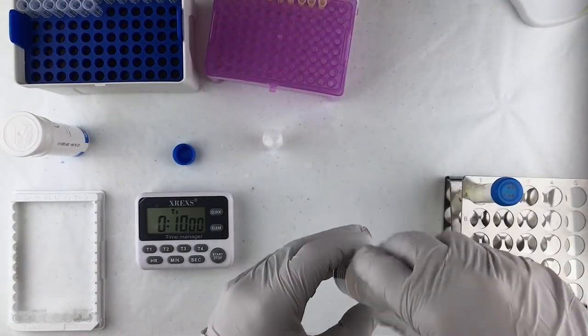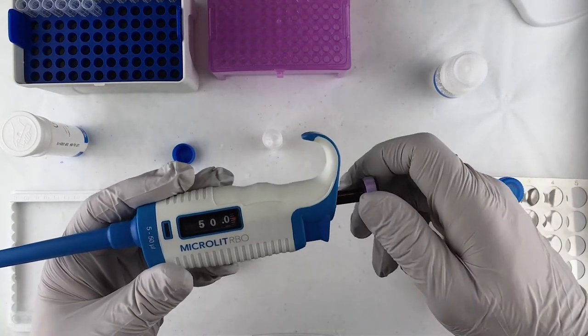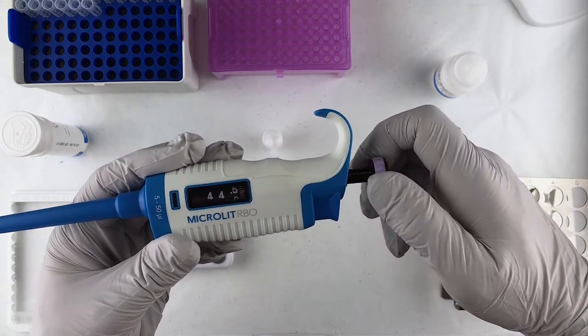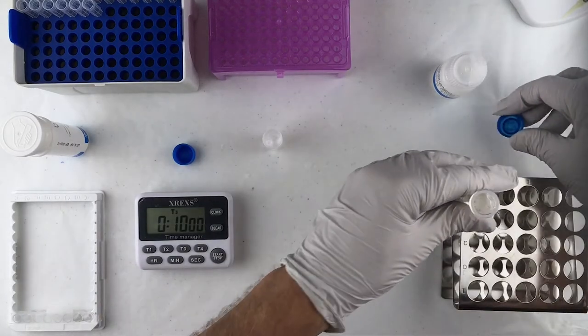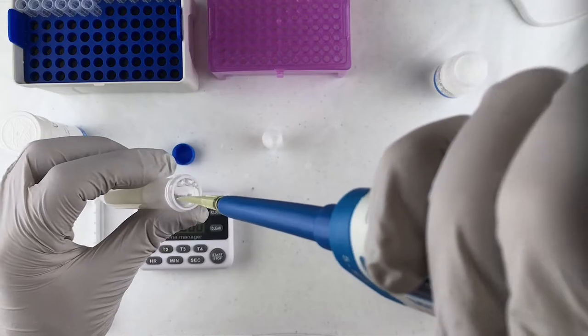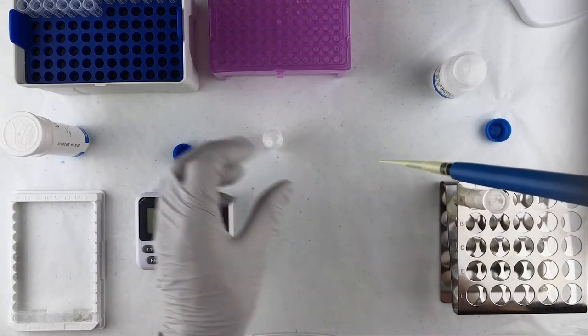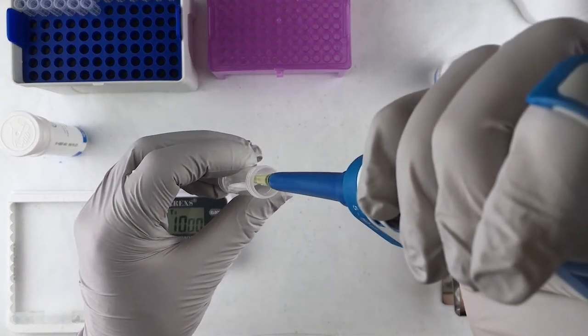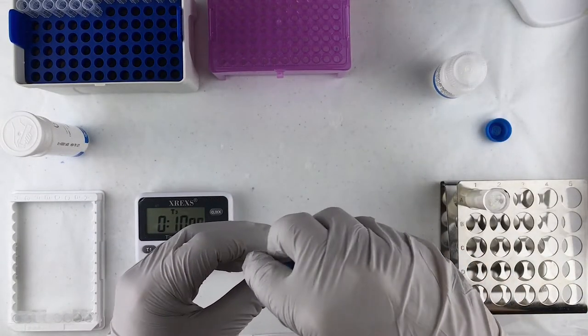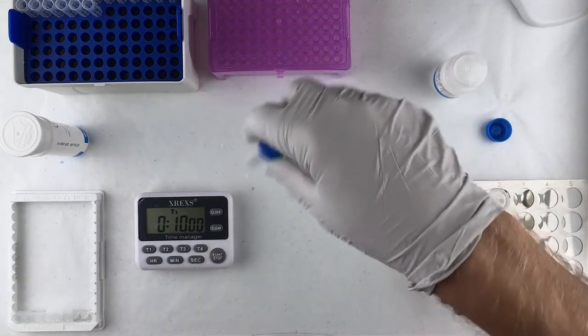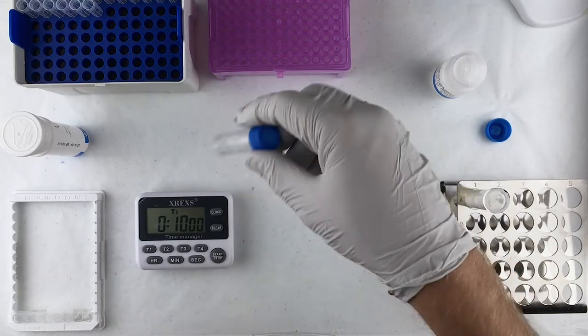Okay, so there's our dilution. Now we've got to combine that with 40 microliters of the food sample. So I've got to run this pipette down to 40. Give this one last shake. Make sure it's all mixed well. So 40 microliters out of this vial. So we'll just kind of mix that up. Make sure the dilution solution mixes well with the food sample.